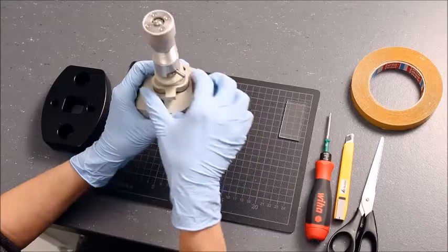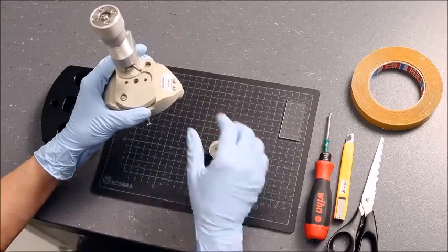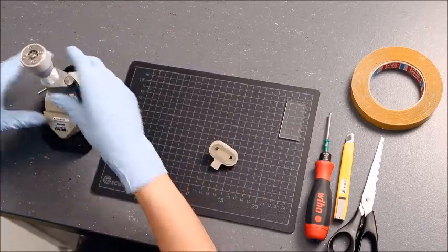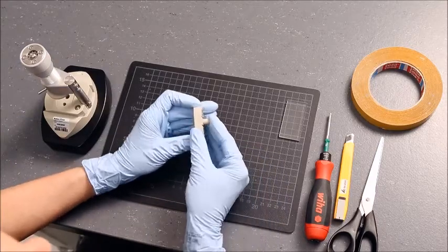Remove the clamping cell insert. Take the sample holder out of the insert.